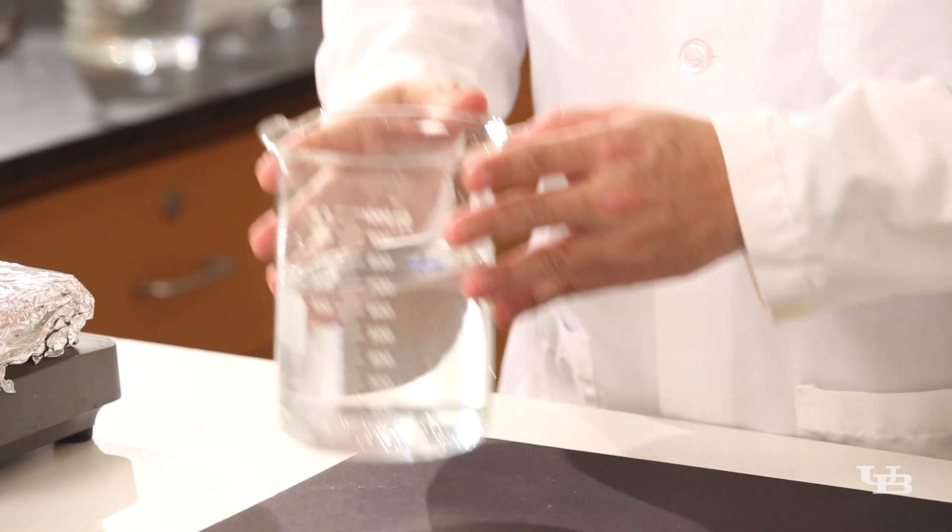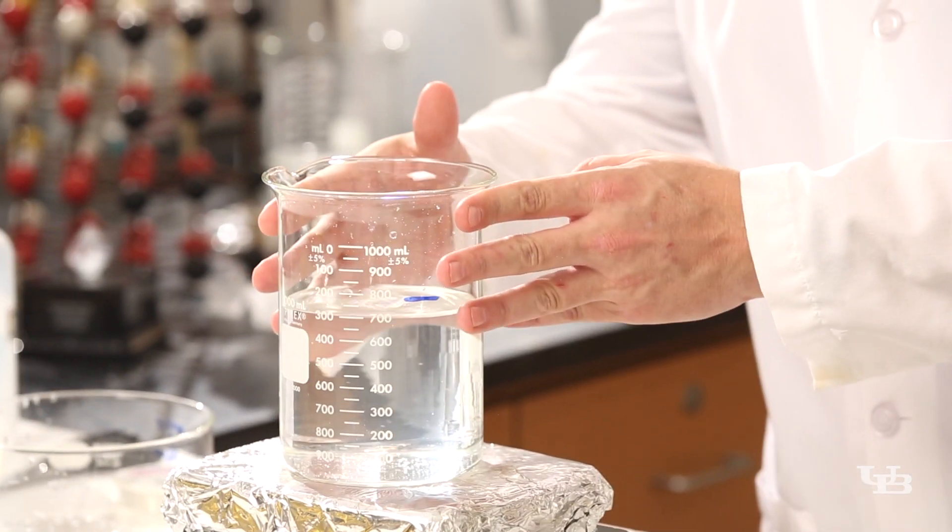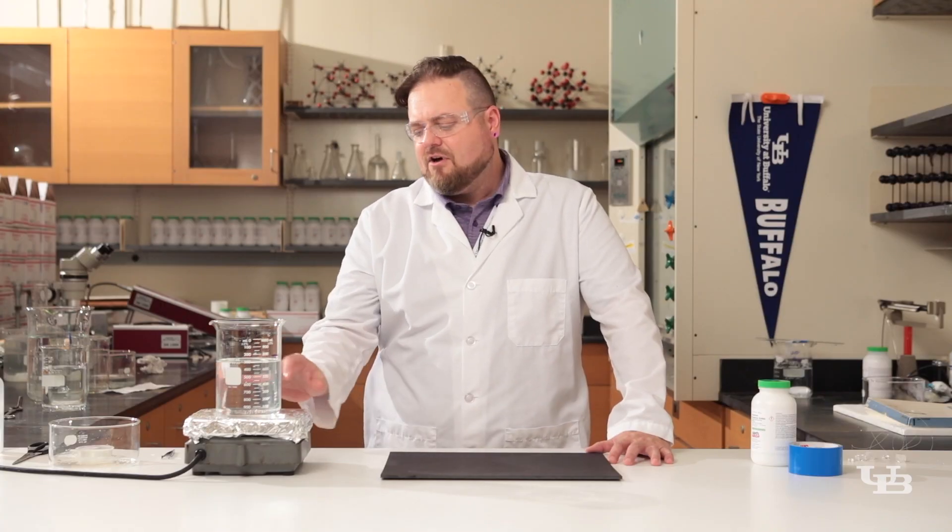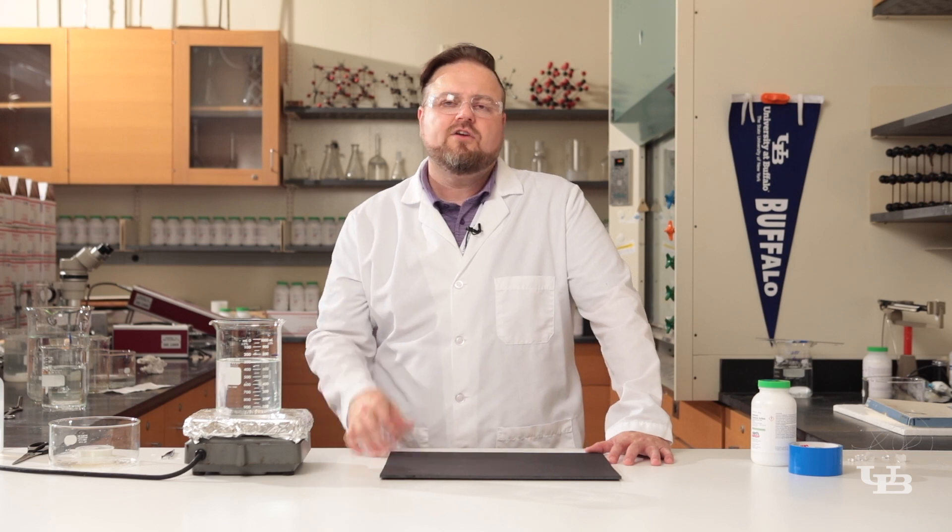We'll go ahead and take our container, put it on the hot plate and let this start heating. If you have a lot of solid material down there you might consider stirring this.